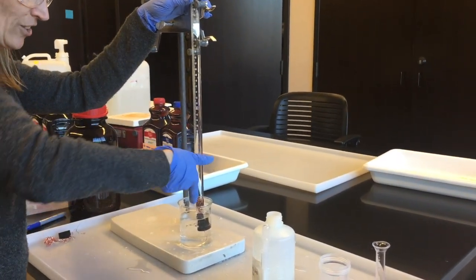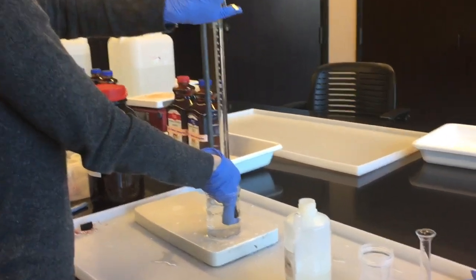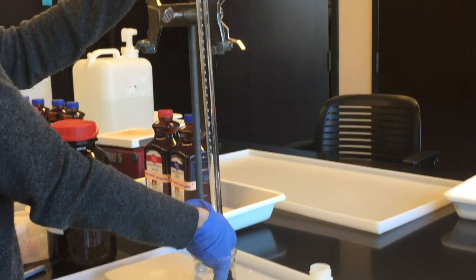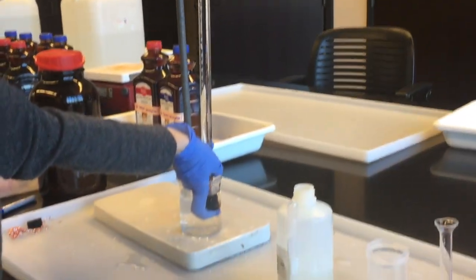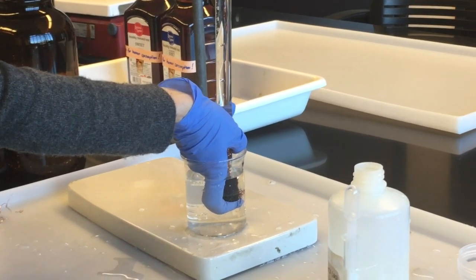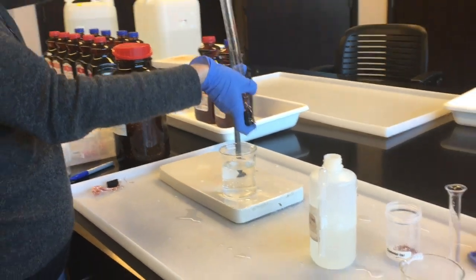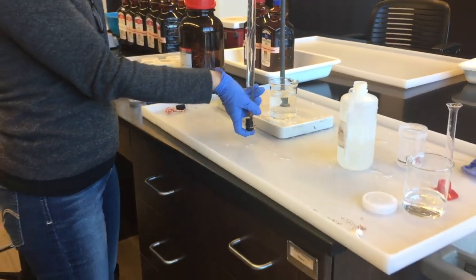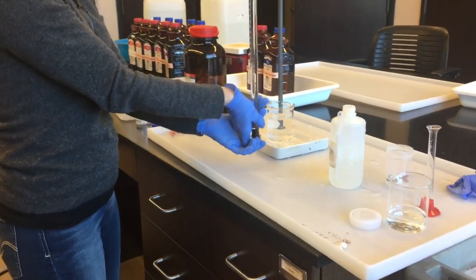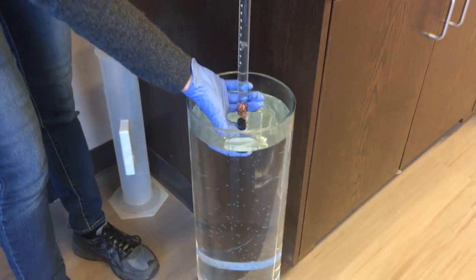You're going to take your finger and you're going to put it down into the beaker, let this come out of the clamp and now I have my finger over the hole in the stopper and I am not going to let any of the water drip out because if I do, I have to start the whole experiment again. So what I'm going to do is lift it out like that, got it carefully, carry it over to this leveling tank and put it down in the water.